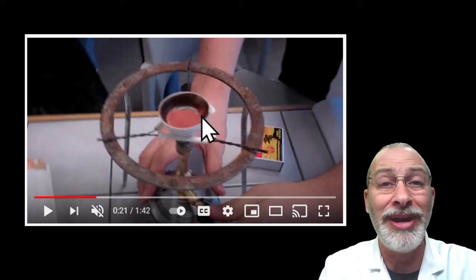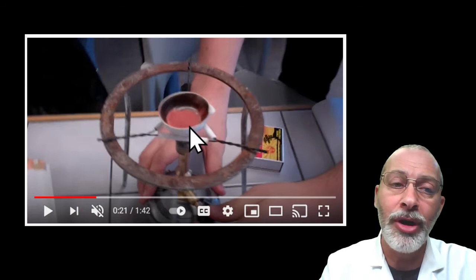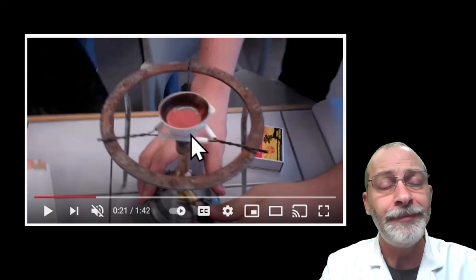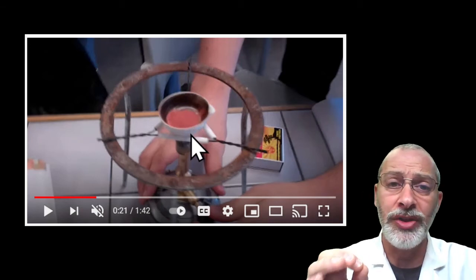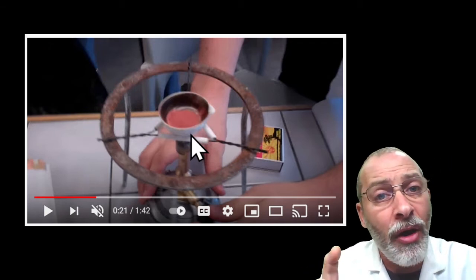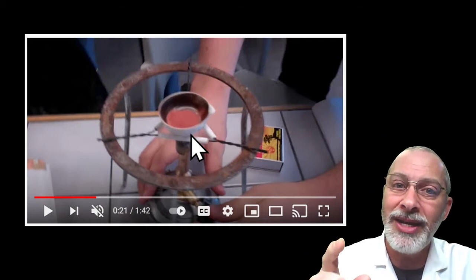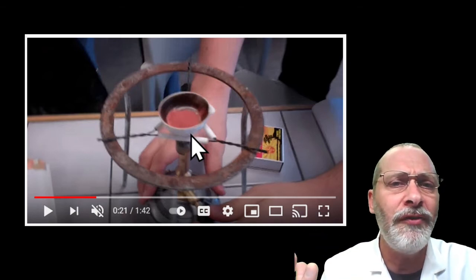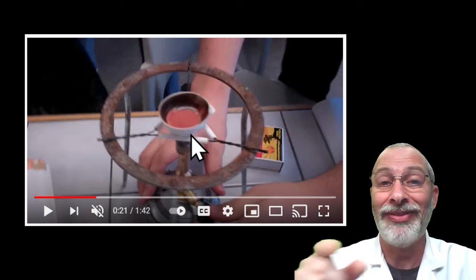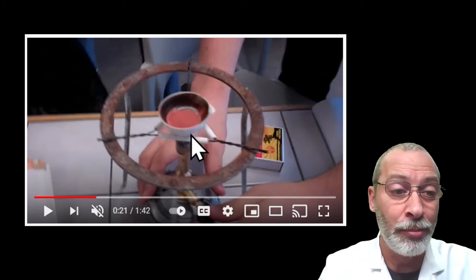Into this dish has been added straight elemental copper, but copper in a powdered form. So when I play this video, I want you to pay attention to the appearance of the copper as it zooms in a little bit, and then also pay attention, thinking about your hypothesis, to how you know if a reaction is taking place or not, and then make your observations at the conclusion of the video. That will be enough information for you to complete the lab.